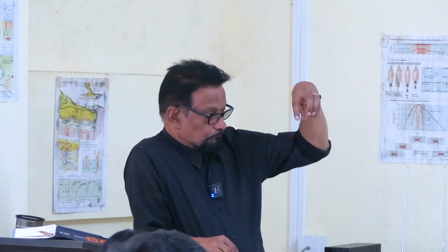So first we will take a normal graph at room temperature. Then we will apply some hot ringer, say of 38 degrees centigrade, on the muscle and on the nerve. The muscles and the nerve are fitted on the myograph. I have taken one simple muscle contraction and switched off.